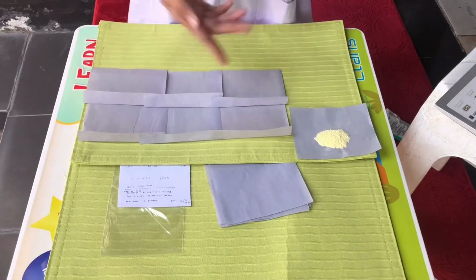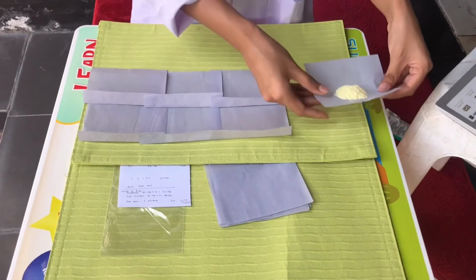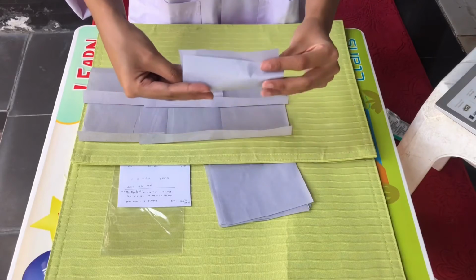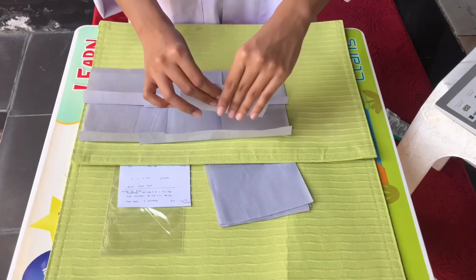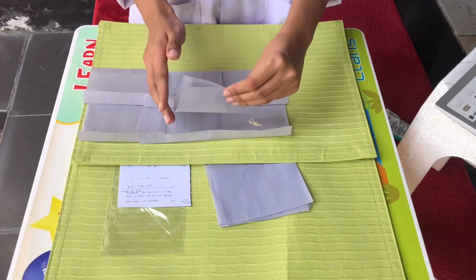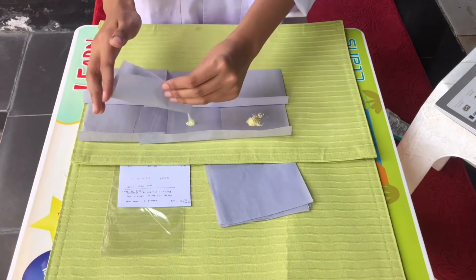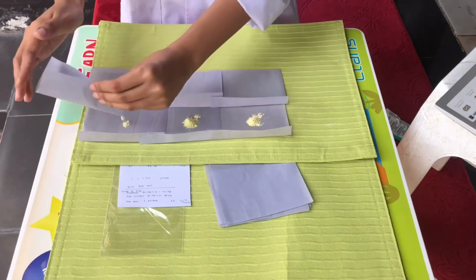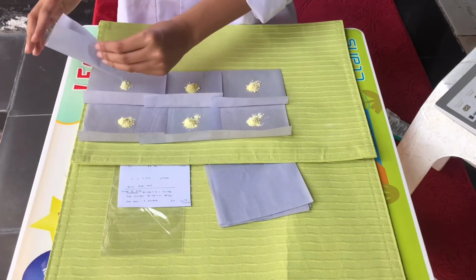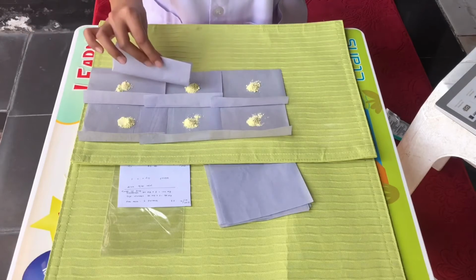After that, now we divide the drugs equally using this method. If possible, make it into a mountain at the center, like this. We can see and check it. See and check how much we should add to make the powders divided equally. Now we check it again, and if some are still lacking, we move some to make it equal, like this.